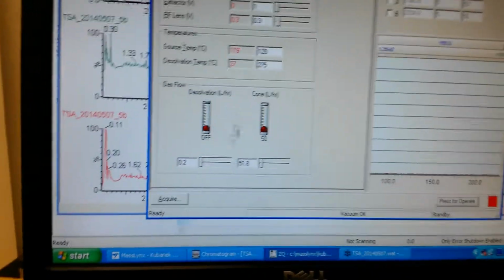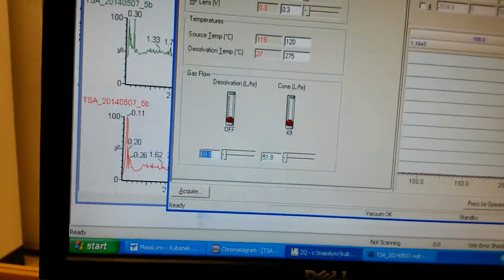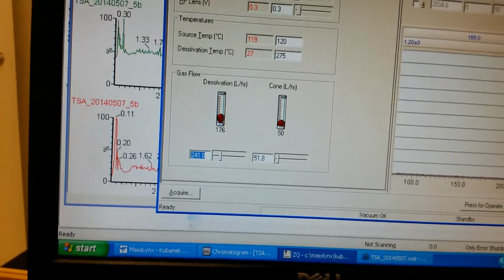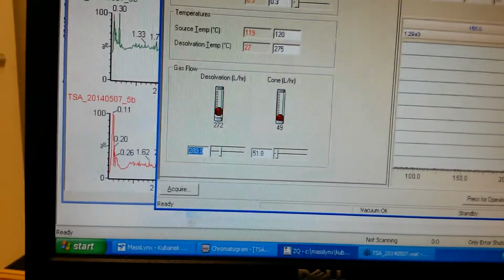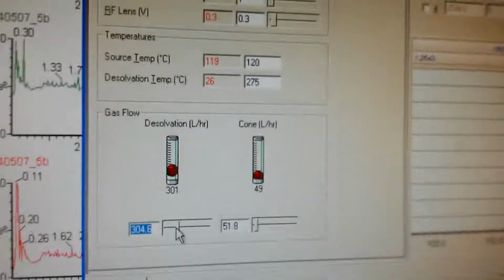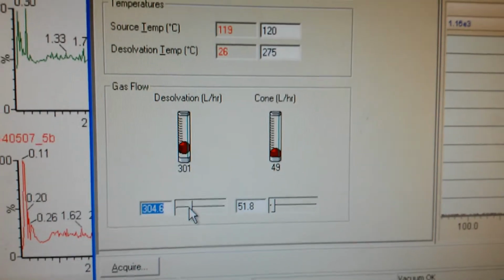I'll try to show you what's going on with our instrument here. I've got the gas flow on, turned on to reasonable values, but the electricity turned off so I can have the front plate removed from the mass spec. So that's what it's currently set to.